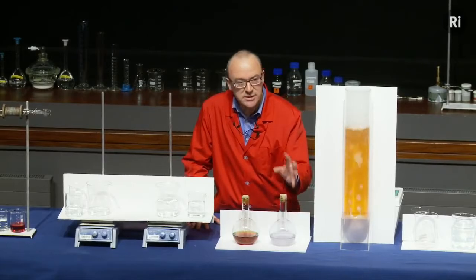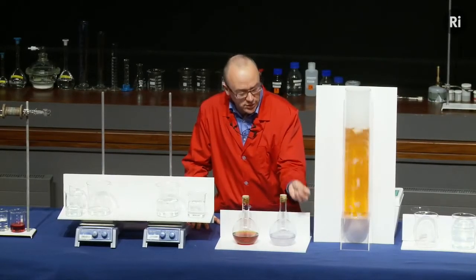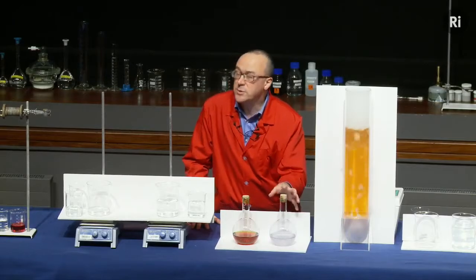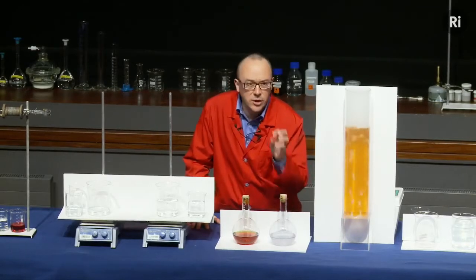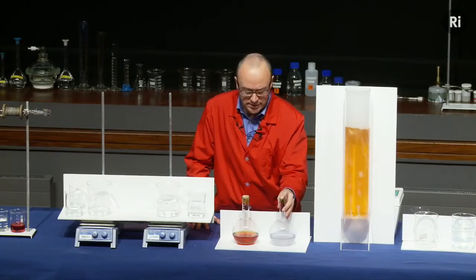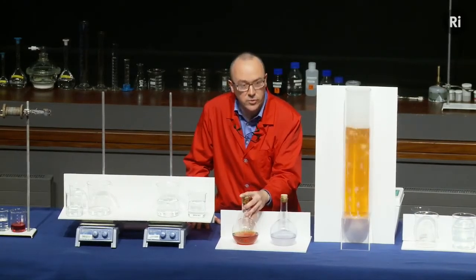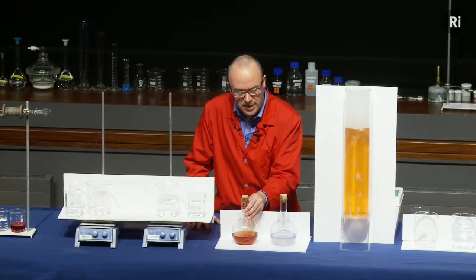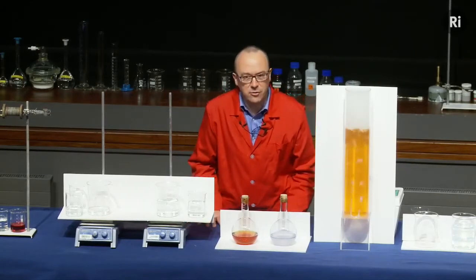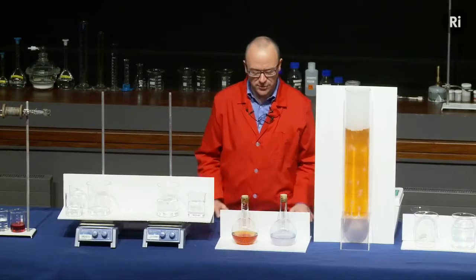This flask contains a dye called methylene blue, and when it reacts with oxygen, it goes from colourless to blue, but also in the flask is some glucose, and that glucose slowly turns the methylene blue from blue colour back to being colourless. And this is the same idea, but with a different material called indigo carmine. So again, we didn't have a chemical reaction going backwards, but we're going to keep on looking for such a reaction as we go through the lecture.